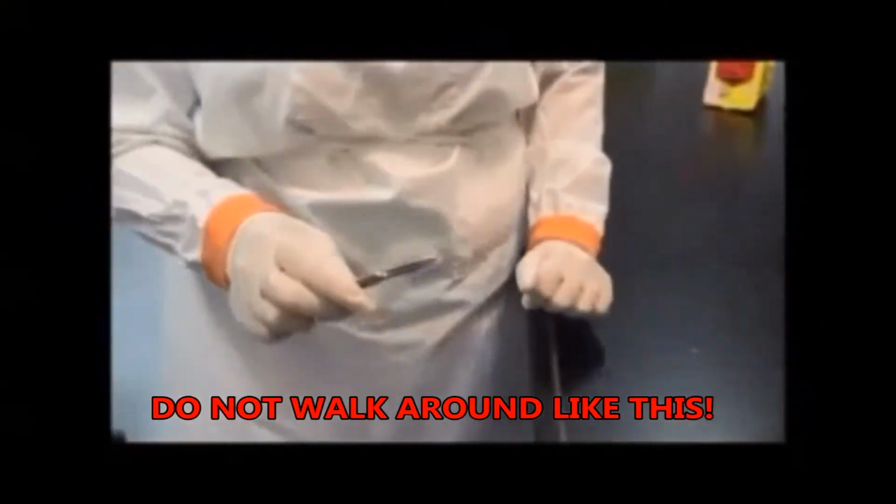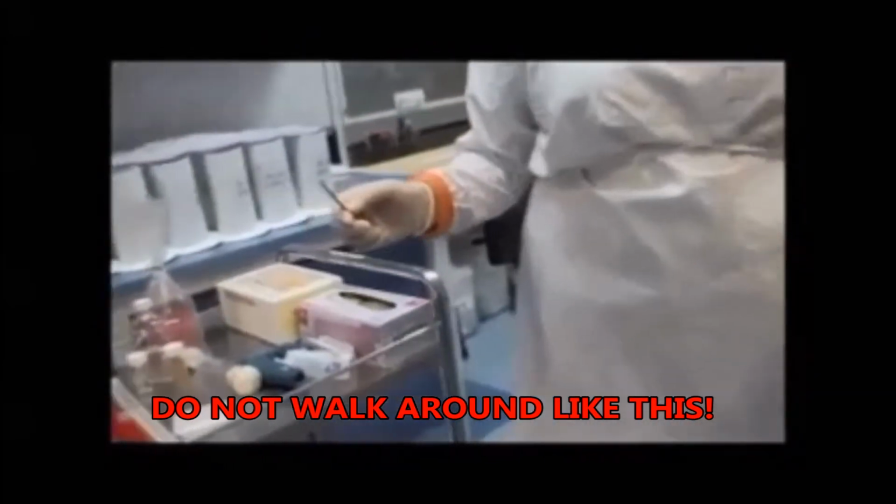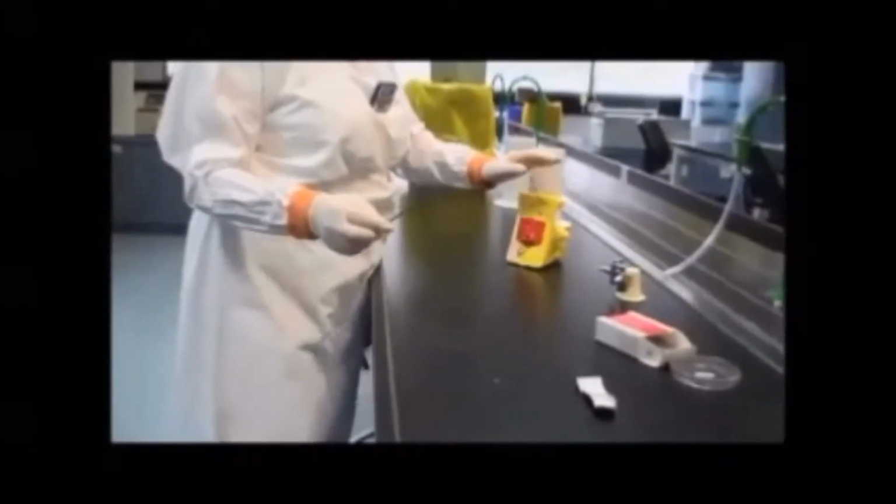Do not walk around like this. Instead, to dispose of the blade, bring the blade disposal container to the bench where you've been working.